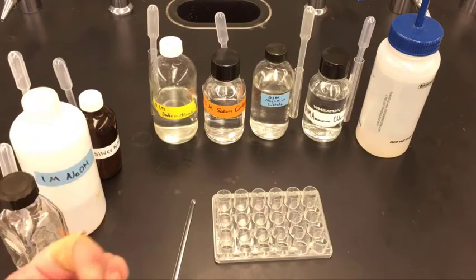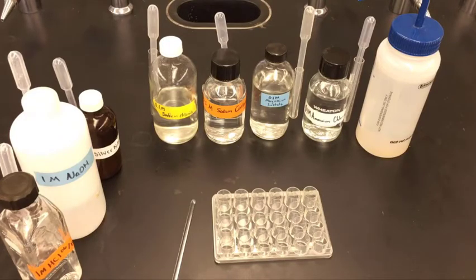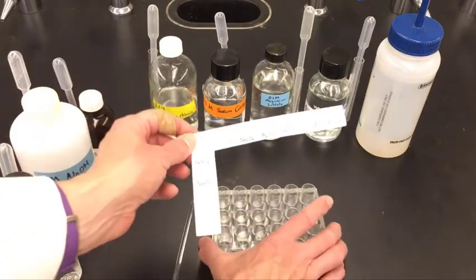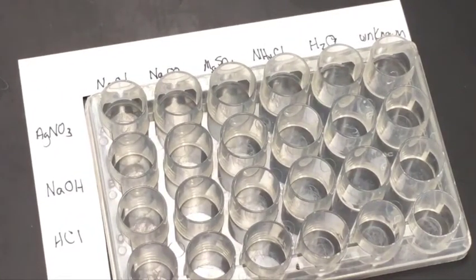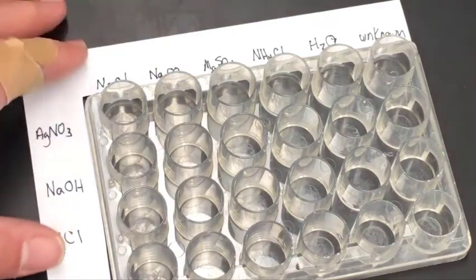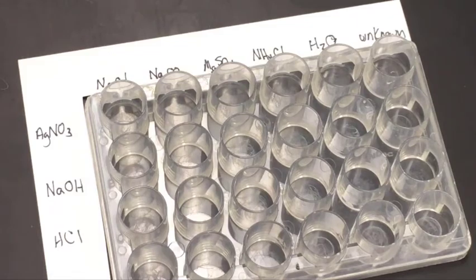A precipitate could look like a really thick solid that falls to the bottom, or it could be opaque. I'm not going to do the experiment for you — that is the whole task of the lab. One thing that might be helpful is to make a template so that you know for each column and each row what chemicals are in your particular well plate. We put the well plate on a black surface because if the precipitate is white, we won't see it against white paper. I have a template going along the top and the side, so I know exactly what is in each row and column. Don't try to memorize it — it's best to record everything so you can actually see it.